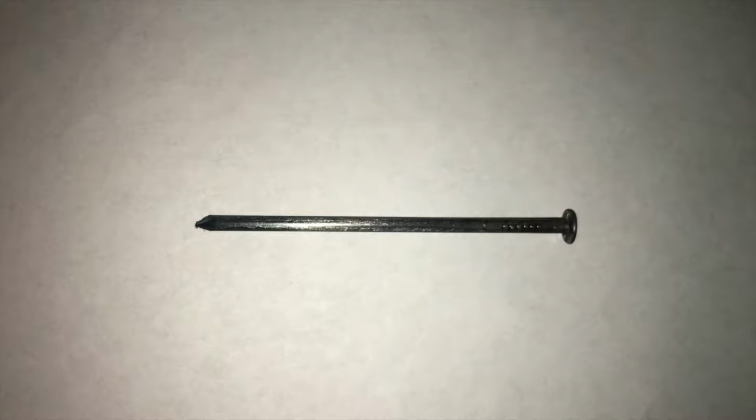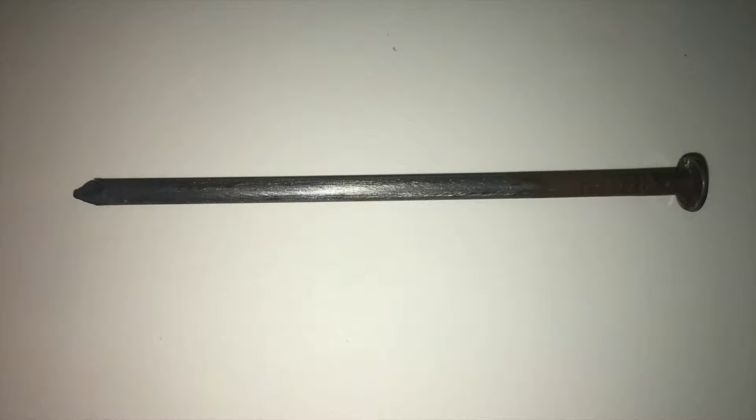This is the nail right after the electrolysis. The left end of the nail is more shiny because it was dipped in solution and therefore plated in zinc. The following picture was taken a week after the experiment. The galvanization by electrolysis was successful because the parts of the nail plated by zinc exhibited no signs of rust, where the other parts of the nail clearly did.